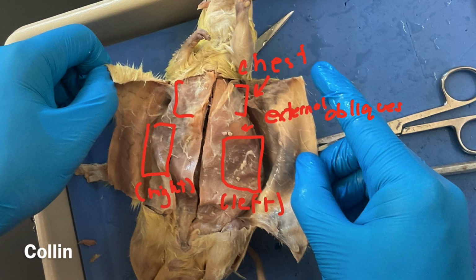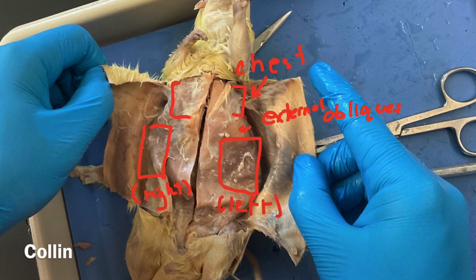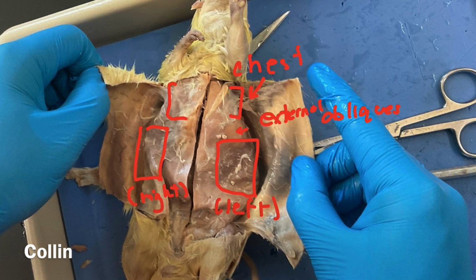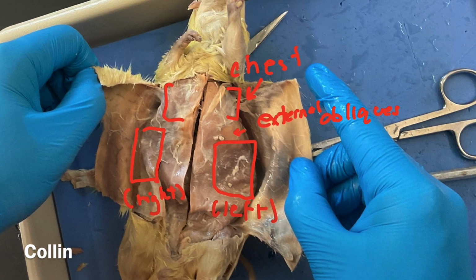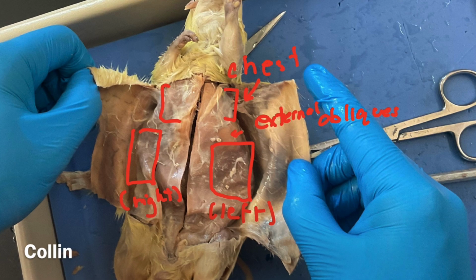These are the external obliques, muscles within the abdominal region, and it functions by compressing the abdominal cavity, flexing the trunk, and producing rotation of the vertebral column, allowing rats to squeeze through tight places.